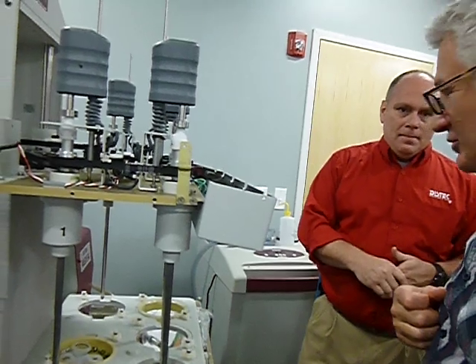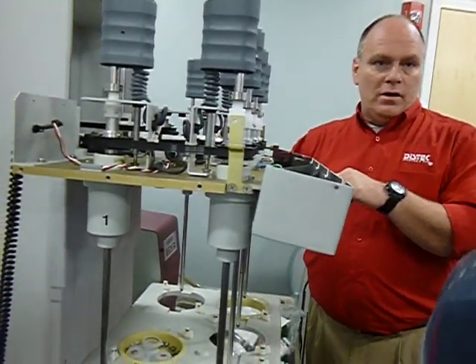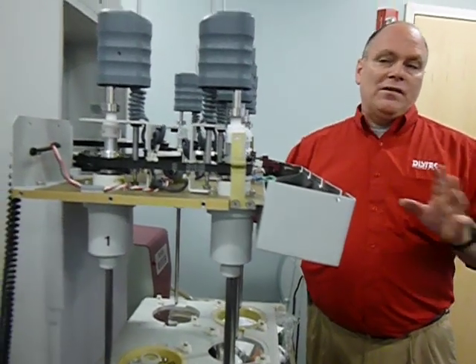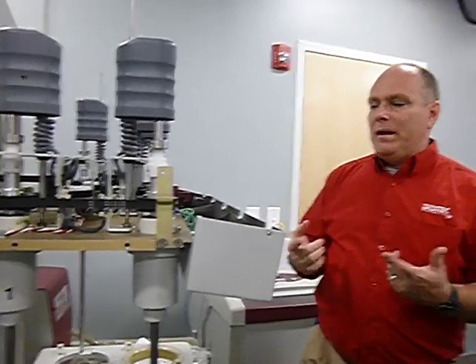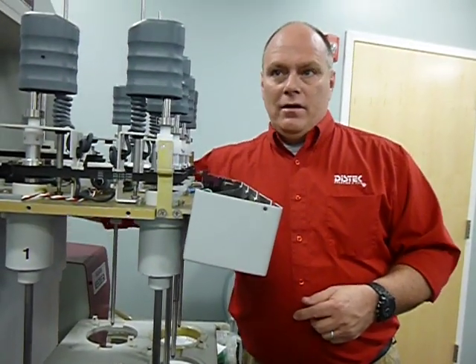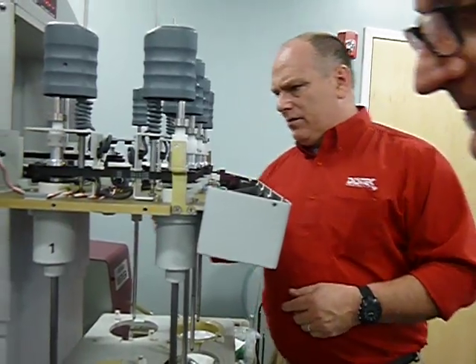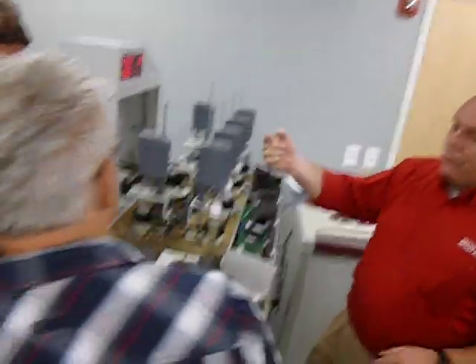It's just a shock absorber, right? Yeah. And this unit here, the 6100, 6300, and the 5100, they're not so hard to change. The 2100 is a pain to change. And the reason it's a pain to change is because this one here just sits in there. It gets attached at the bottom and it just sits in the bottom. On the 2100, it's attached at the top and the bottom, and there's a screw that has to go on the top.